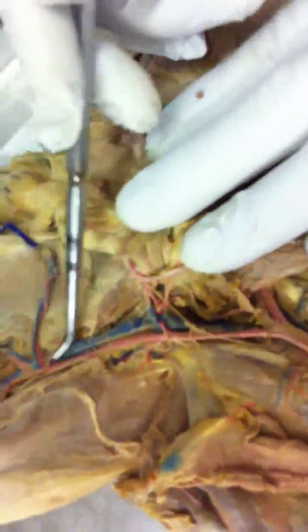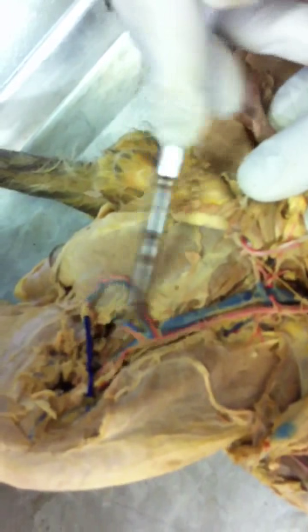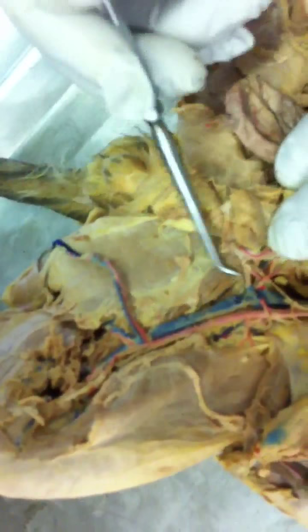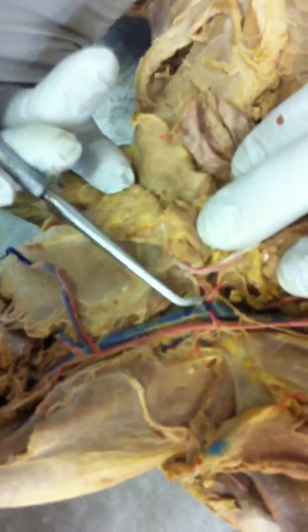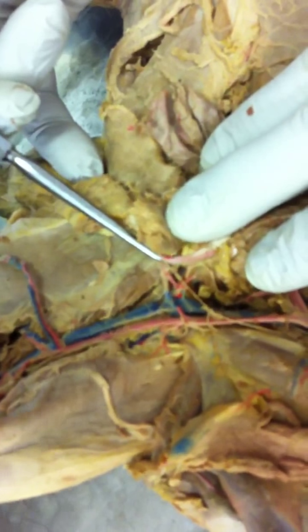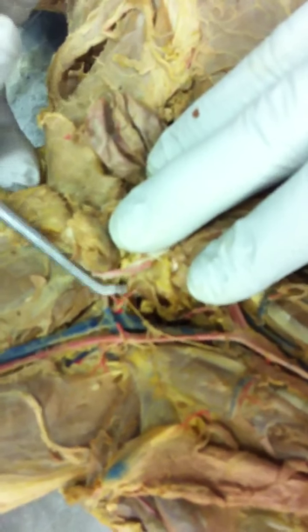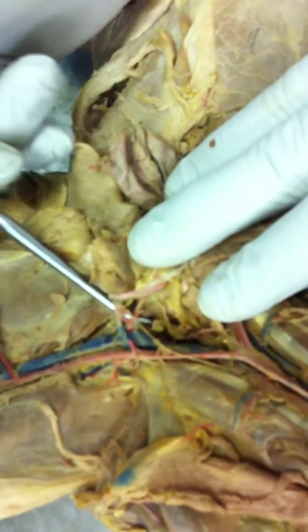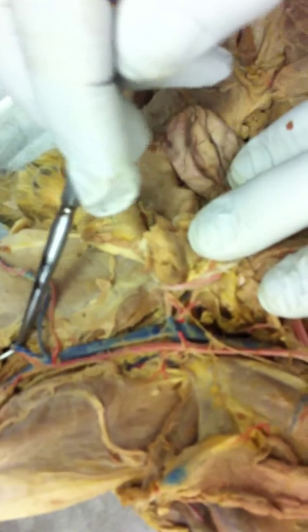And then coming off the middle is the proximal caudofemoral artery. It's not this one. Everybody sees this one and thinks that it is. We don't learn it in this class, but here it is, so I might as well differentiate it. This is the medial circumflex, which isn't in our curriculum, but it's there, and it's not there on every cat. So don't confuse that with the proximal caudofemoral.